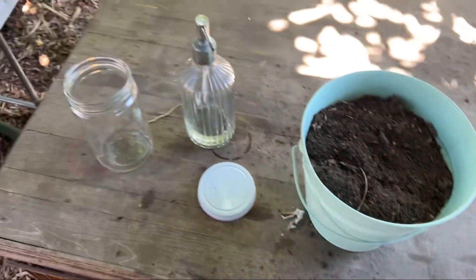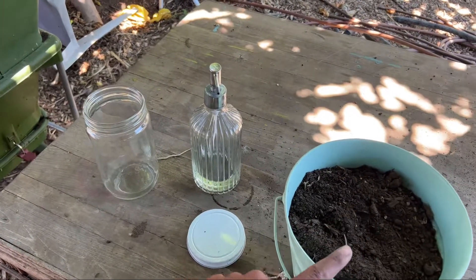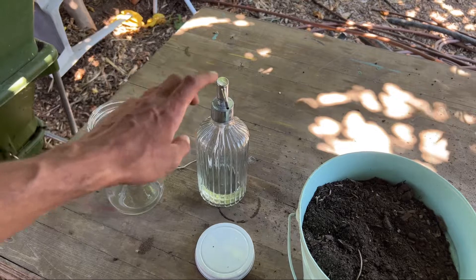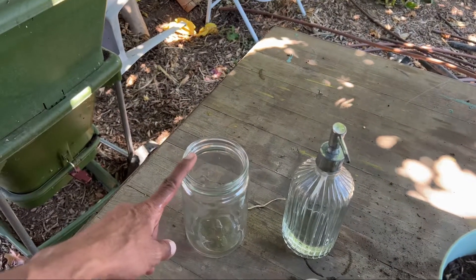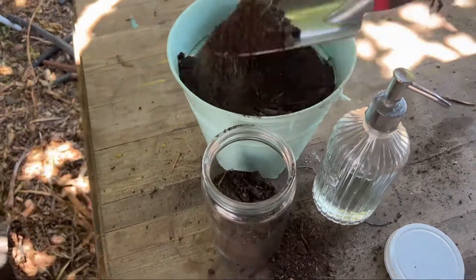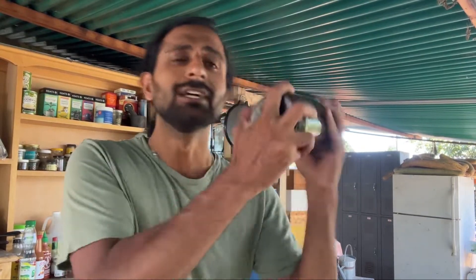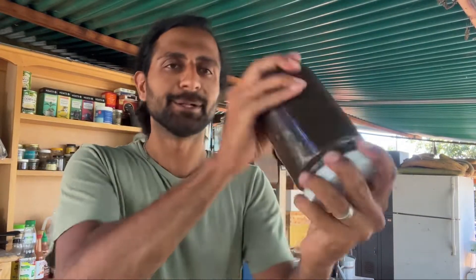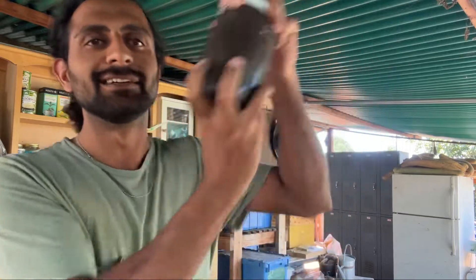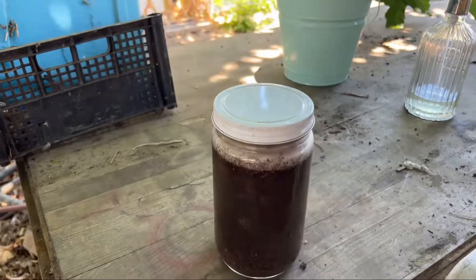What I'm going to do next is just fill my glass jar halfway up with my aggregate soil sample, add about three pumps of soap, and then fill that jar with water. Last step — shake it, shake it up, shake it well.